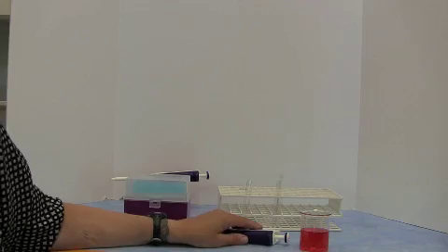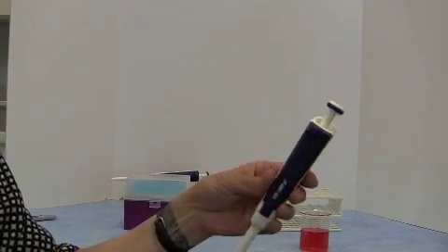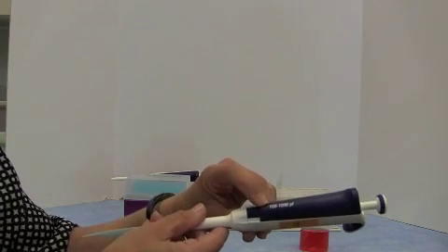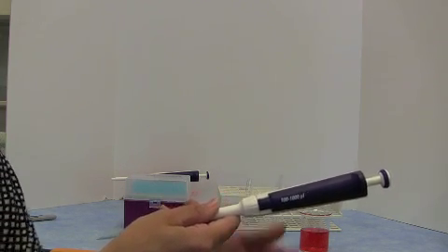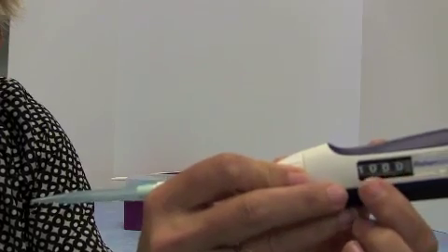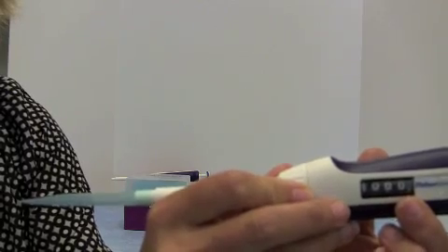In today's lab, you're going to use two types of pipettes. You're going to use this one here, which we call a P1000, and on the side it's written 100 to 1000 microliters. That is 0.1 mil to 1 milliliter. And if you look on the front here, let's get this in focus. There we go. On the front you can see it says 1000. So this is actually 1000 microliters.